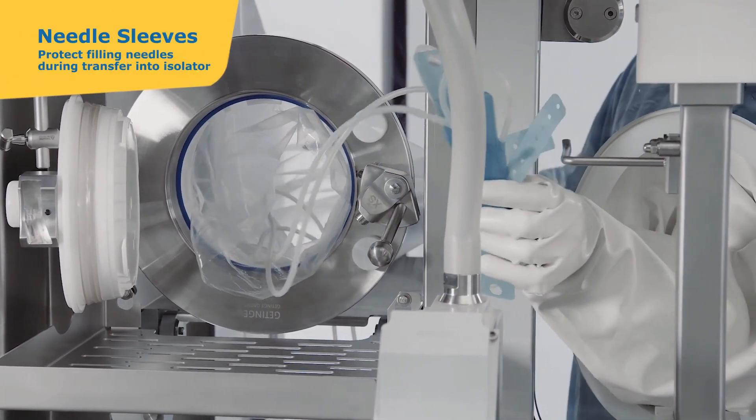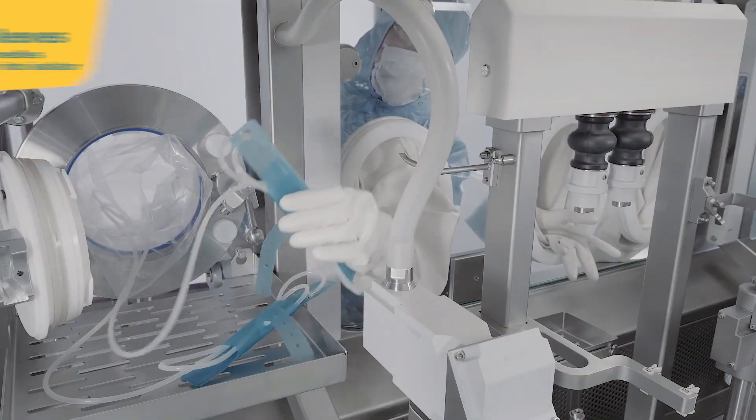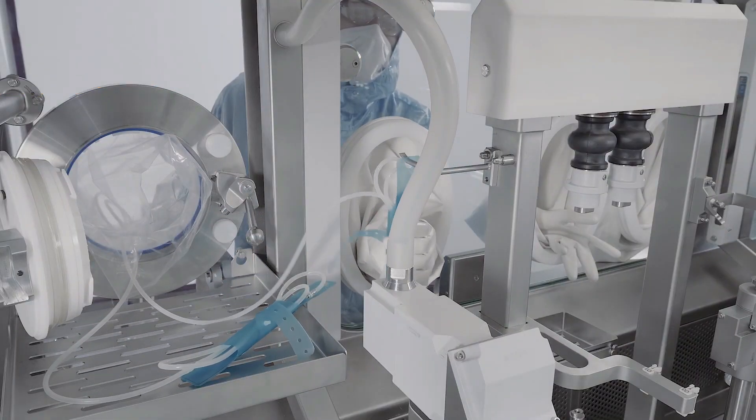Isolators can be used to maintain a grade A environment, often placed in a lower grade area, such as grade C or D.